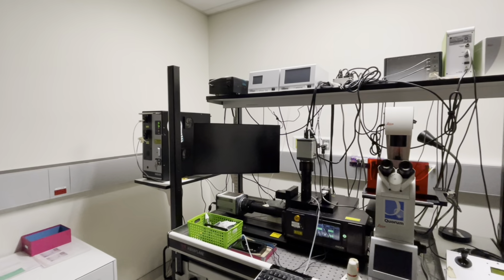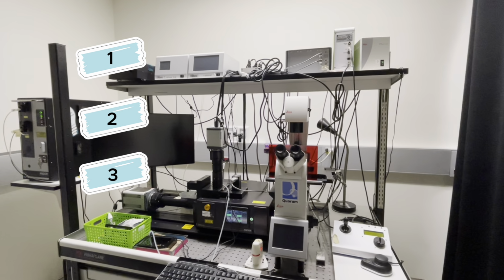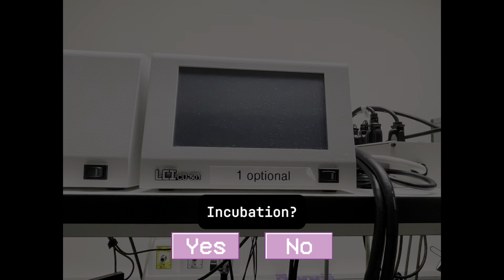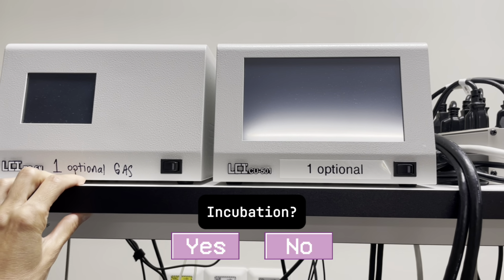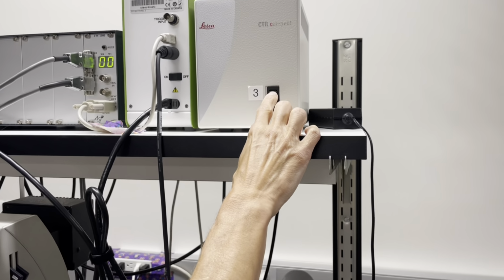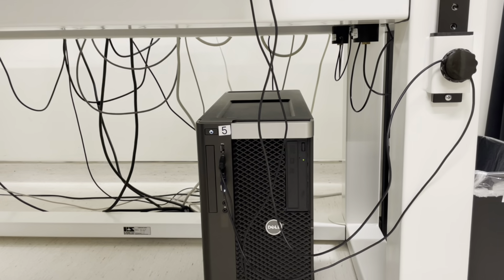In order to turn on an instrument, first you must identify switches with numbered stickers and proceed to turn them on in order. Importantly, you do not want to turn on any switches that are not numbered, as it'll impact the ability for the microscope to function. On this system, number 1 is optional because it's for gas and temperature, so we're going to skip that if you're not doing incubation. There's number 2 for main power, then number 3, number 4, and number 5 is the PC.